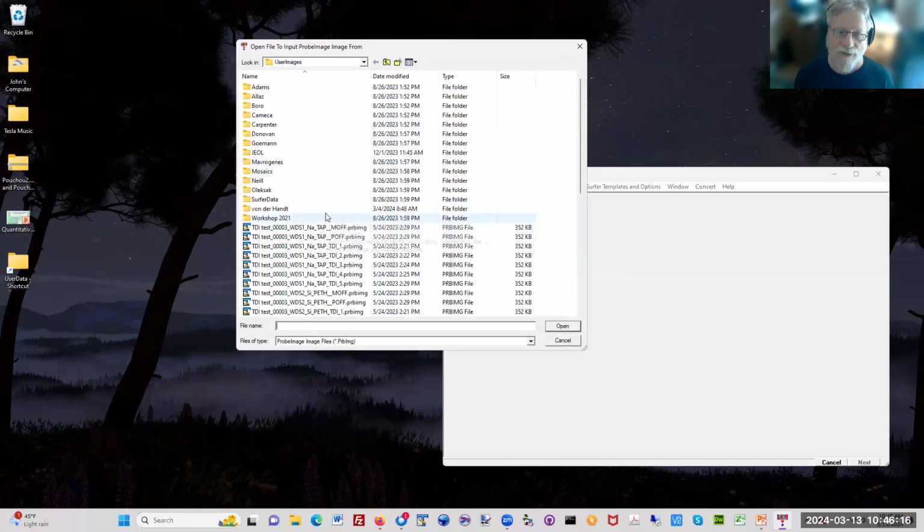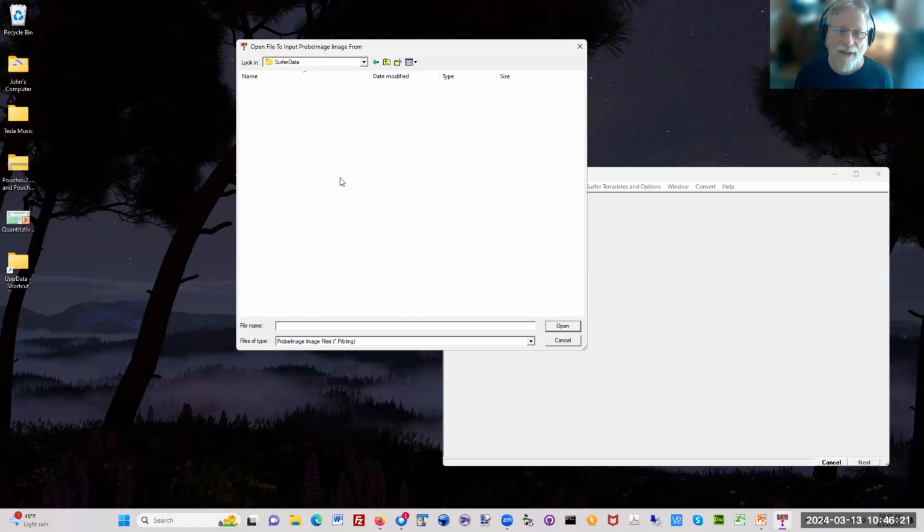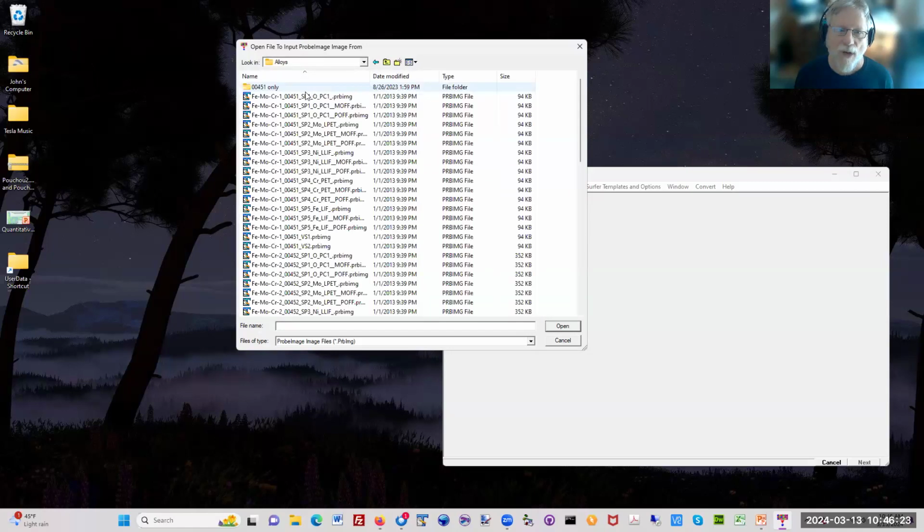So in this case, I'm just going to do a very simple process of looking at one map, one pass. So it's just going to be 5 elements. And in this case, we did off-peak maps and on-peak maps. This is the on-peak map here. And then the off-peak maps, M is minus, P is positive, offsets. So I'll just select one of these maps. I click open. And if I had more maps to do, more elements, then I would load in another map from that set. And I click cancel at this point because I'm all done now.